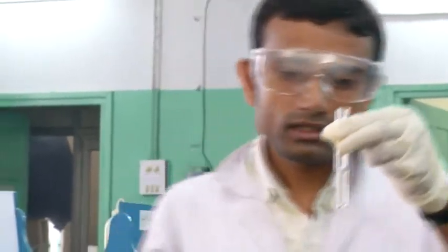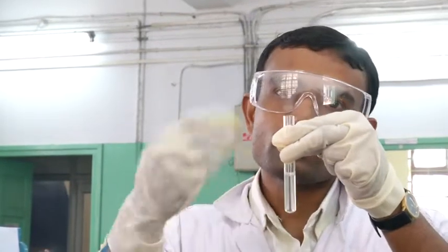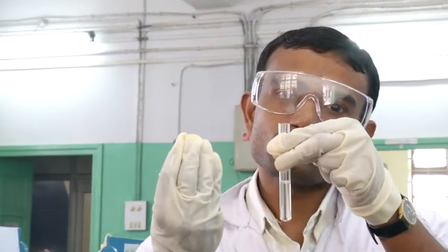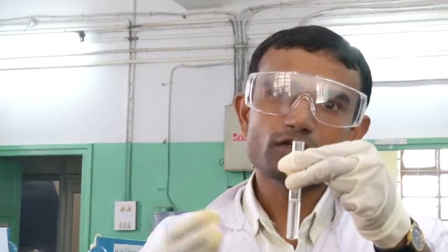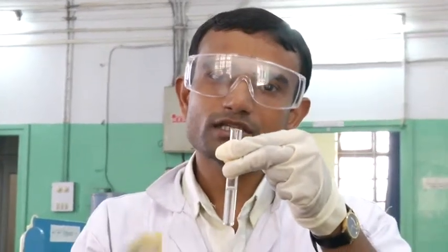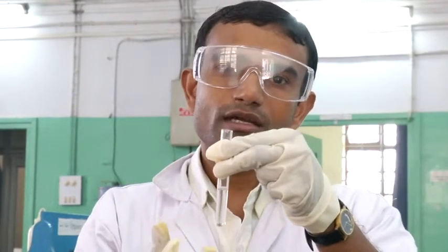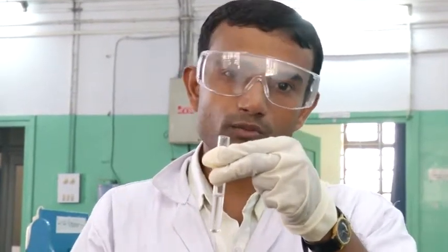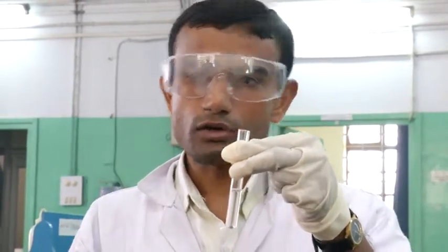Now I will add ferric chloride solution. Remember, when we add ferric chloride solution, the drop is just slowly going inside and you can see the coloration around the drops. If you add it and go back to your bench to see the color, you will miss it, because by that time the complex of hydroquinol with ferric chloride will decompose — hydroquinol is easily oxidized to quinone and you get a yellow coloration. So you have to observe while you are adding the ferric chloride drops.